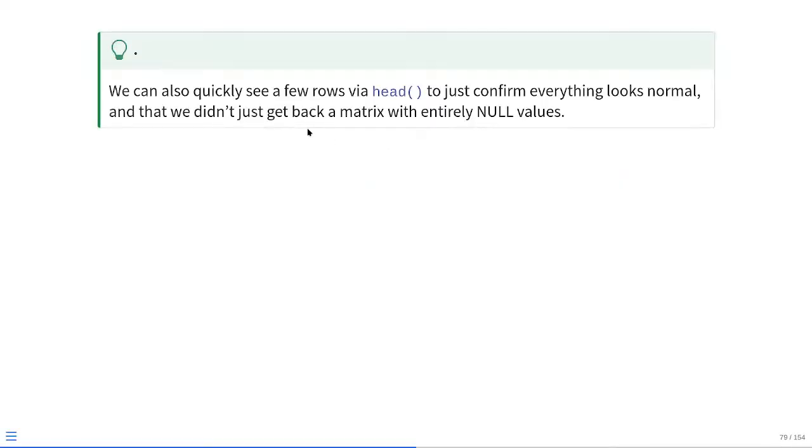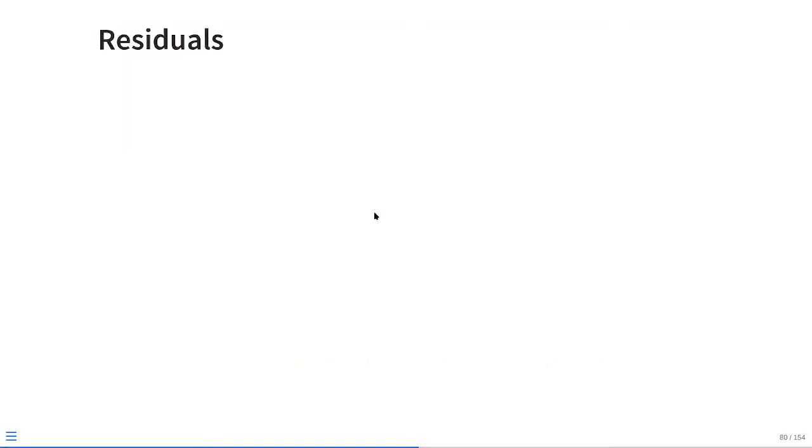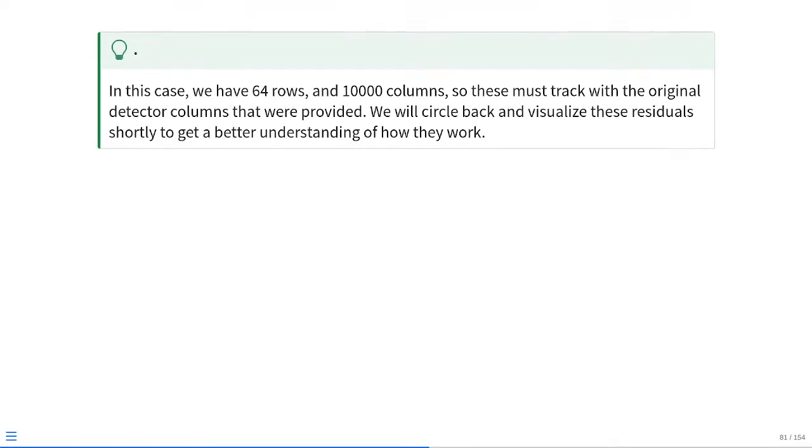We can also quickly check the first few rows with the head function, just to make sure everything looks normal and that our matrix is not full of NA or null values. If we run it, yep, we got numeric values coming back, so this looks as expected. Next up, we have residuals. Let's check them with the dim function as well. In this case, we see there's 64 rows and 10,000 columns, so this matches what we had for our raw spectral data before we unmixed. We'll circle back and see how to investigate these residuals, because there's some data that can be visualized from them that might be useful to know about, but we'll check on this a little bit later on.